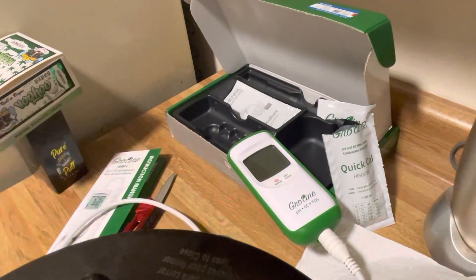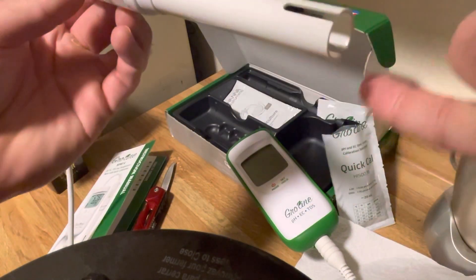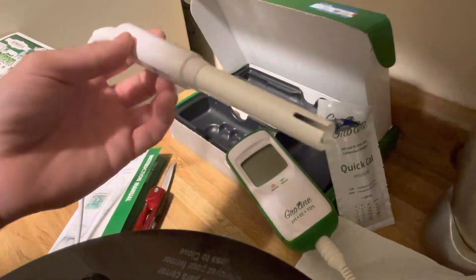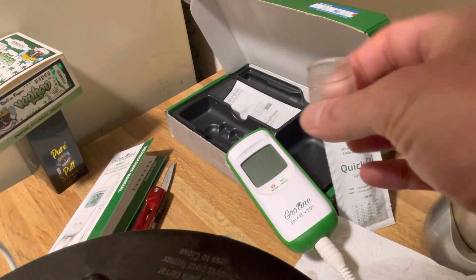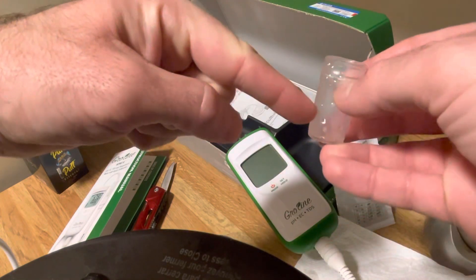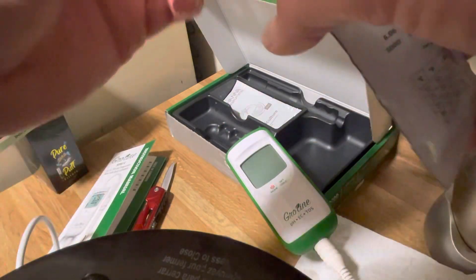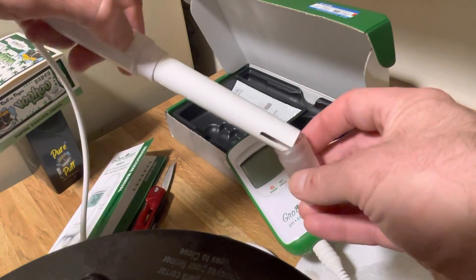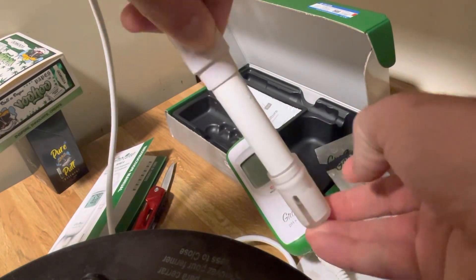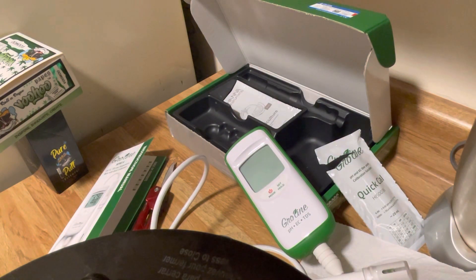We unboxed it, put the batteries in, re-screwed the back protector on, got the nice rubber case around it, and attached the probe. I talked about how there's a protective piece on this probe that you're always going to use — right here. What I like to do is take that storage solution and pour some in here, then close this off. Easy as that. Since the Quick Cal has some electrical conductivity, it's actually a good storage solution — it's got minerals in it, so the minerals are going to protect and not damage the probe. The probe is now in that liquid and we're ready to go.